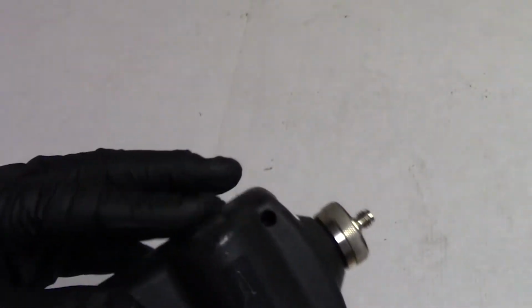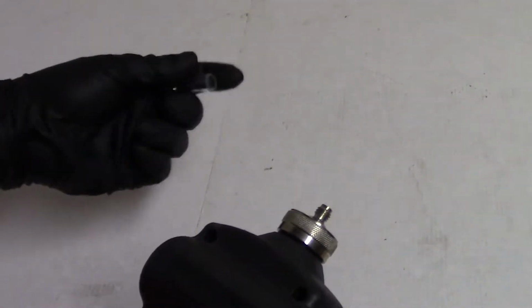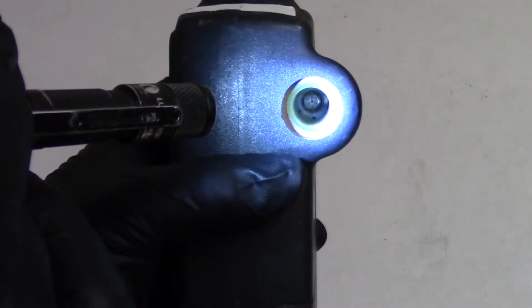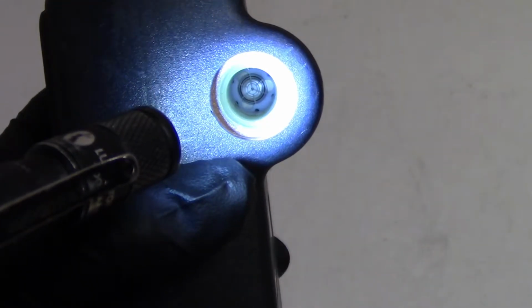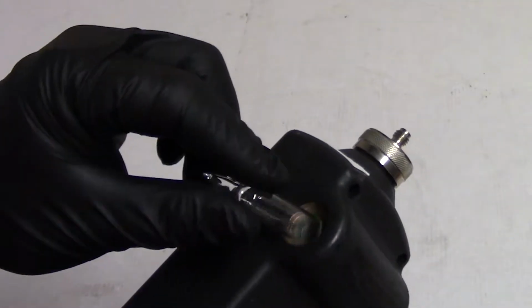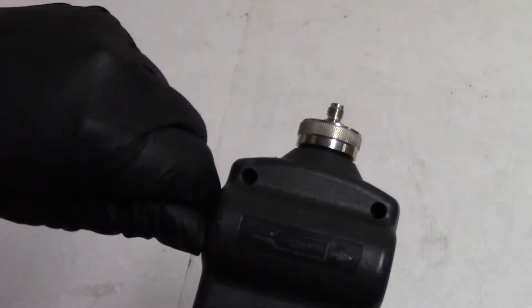Actually, let's see if we can see the sensors. Let's take that out, pretty sure I don't want to touch the face of it. So there's the grid array down there, the target. There it is down the bottom. So that's where the gas actually goes through to be ionized and measured. And that's probably also how the UV is activated. And I'm not sure on that part. That's the only part I'm not really sure on, is how they energize this lamp to make the UV. But it's probably something to do with, you know, high voltage around it.